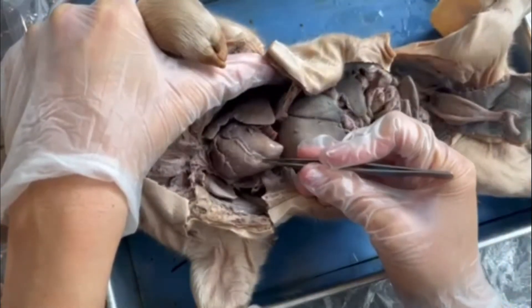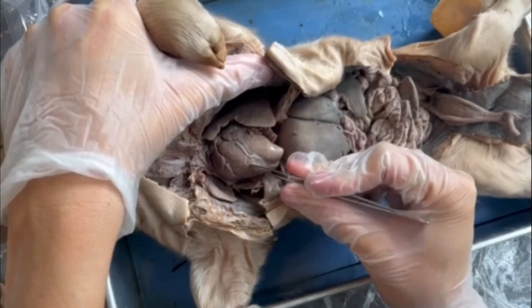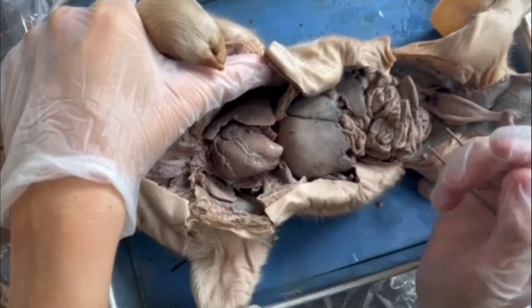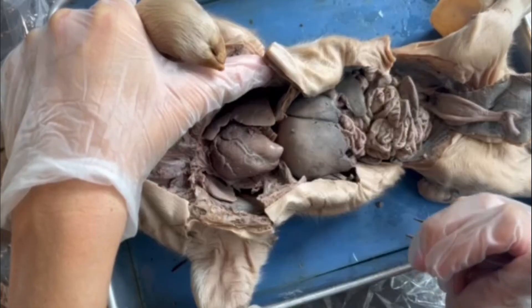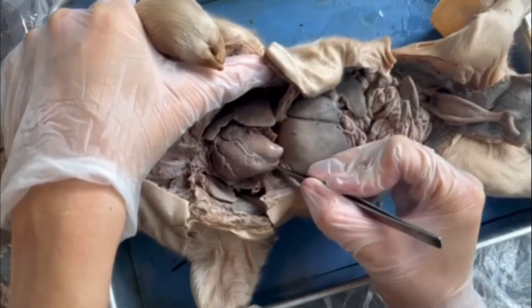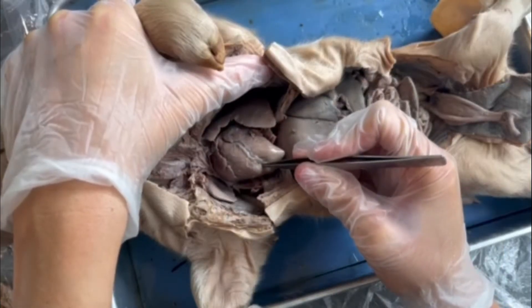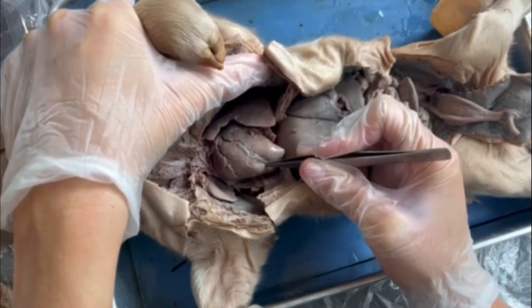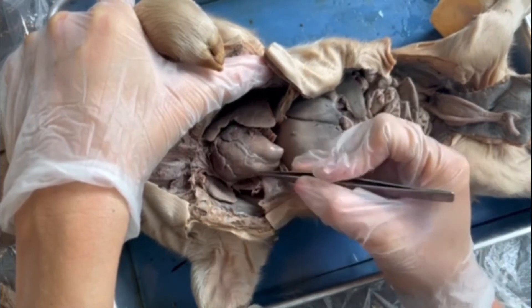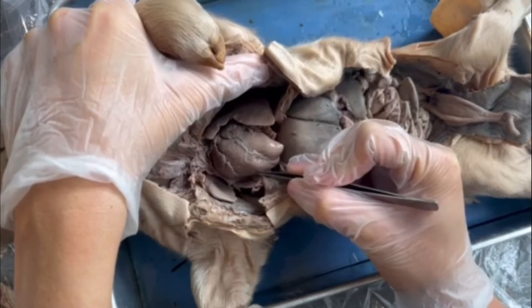If this artery gets blocked or blood's not able to travel down it, the heart muscle won't receive oxygen and the heart muscle will start to die. That's a heart attack, also known as a myocardial infarction — when the heart muscle itself can't receive oxygen down the coronary artery. The coronary artery also allows us to differentiate between the left side and the right side of the heart.